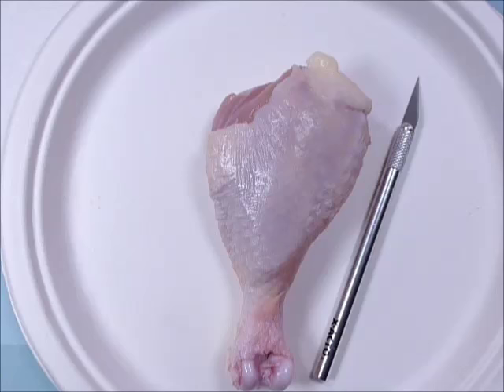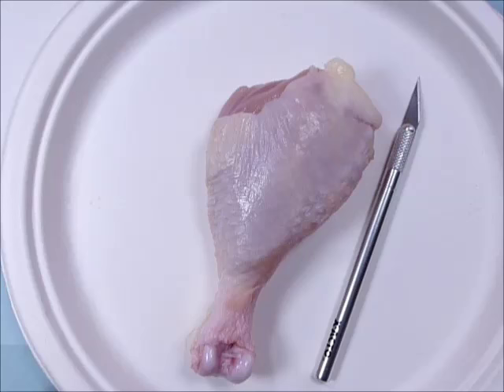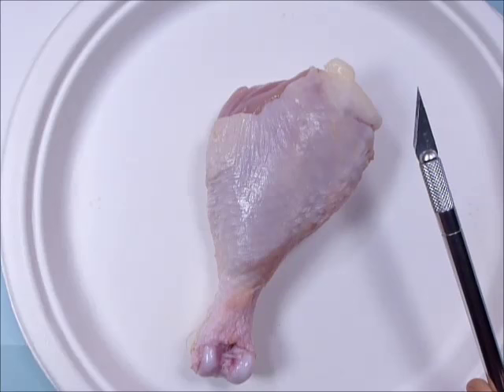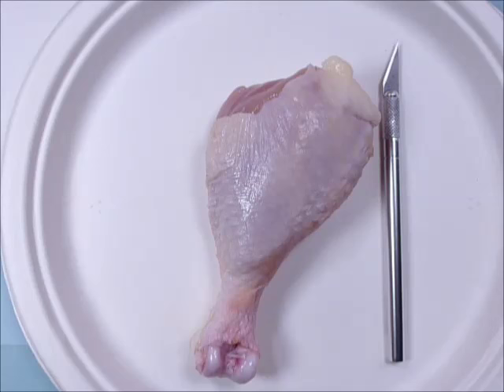We're not going to have a microscopic view, so we can't say 'look, there's a fat cell.' We'll just do the best we can and point out the obvious things. Find a clean work surface and a sharp utensil — an X-Acto knife with a fresh blade, a dissecting scalpel, or scissors. Mainly I use my hands, just patiently ripping and tearing. Your fingers are pretty good tools, so you have to not mind getting messy.